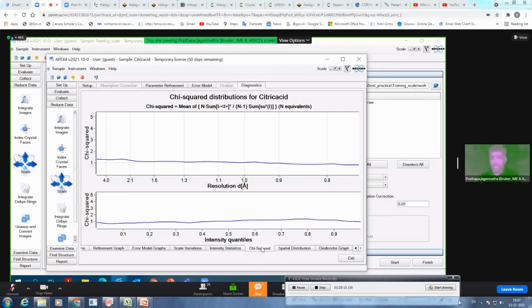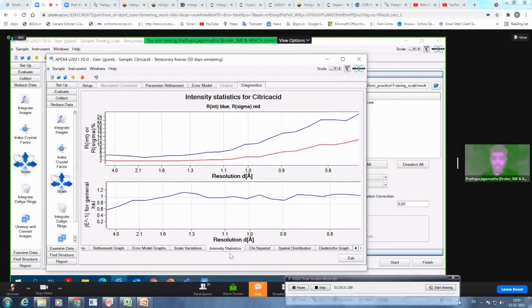Then generally, if the scaling is good, your chi-square statistics against the resolution should be 1. In this case it's 1, so it's correct. And then if you look at the intensity statistics, R int and R sigma versus the resolution, at lower resolution it is much better. As soon as you go to higher resolution, the reflection quality will become weaker, and then you expect slightly higher R int and R sigma.